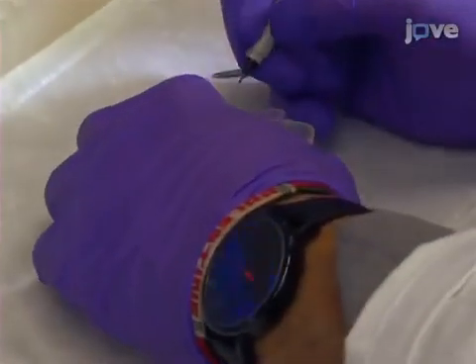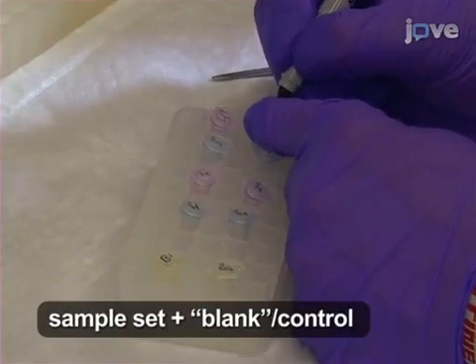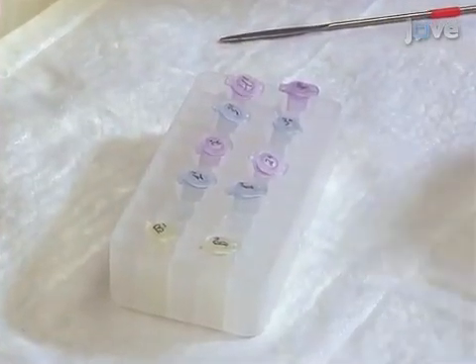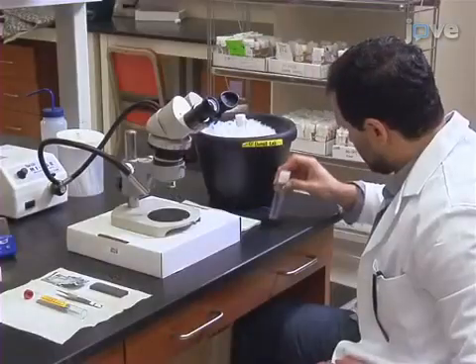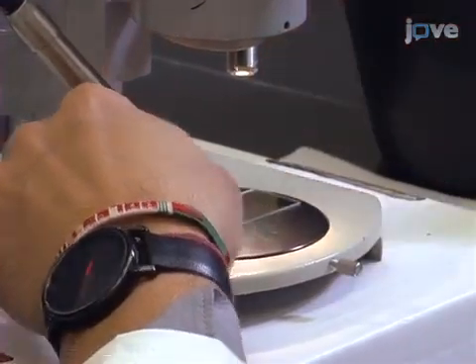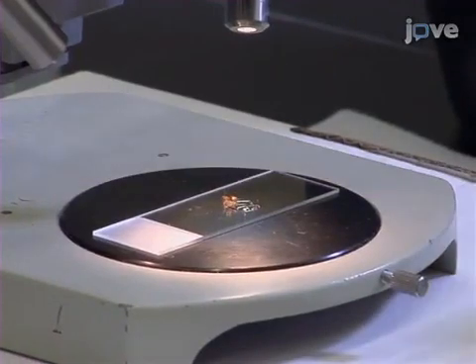Aliquot 50 microliters of Grace's insect medium into the appropriate number of wells of a 96-well microtiter plate, or in centrifuge tubes as demonstrated here, and label suitably. Fully anesthetize the flies, then transfer several flies to a microscope slide. Add a small amount of PBS as a dissection buffer.